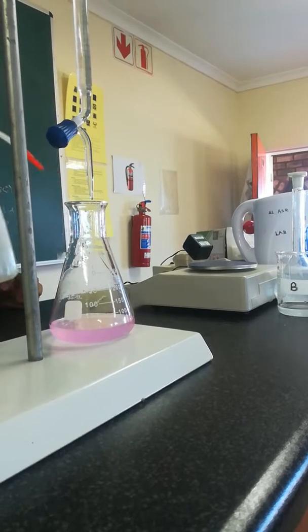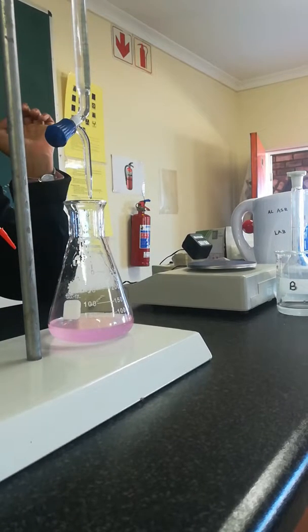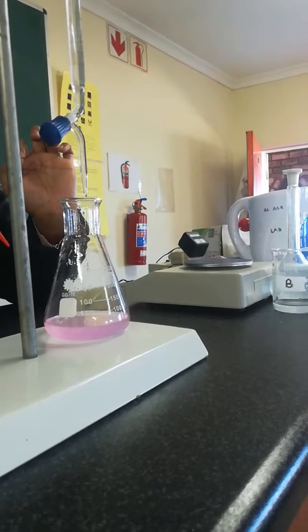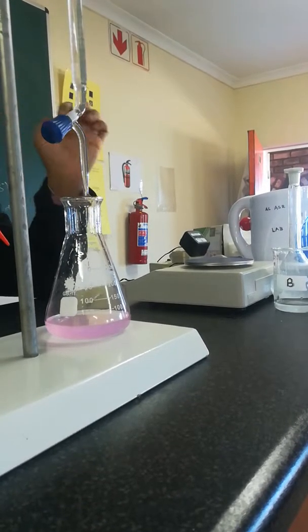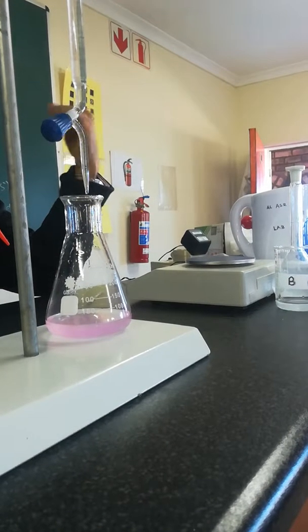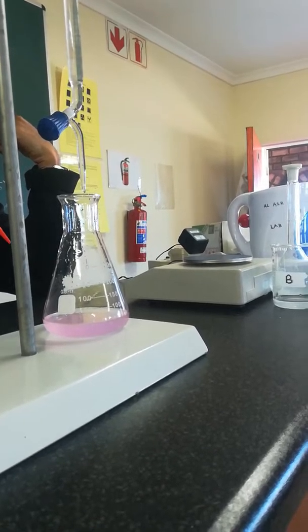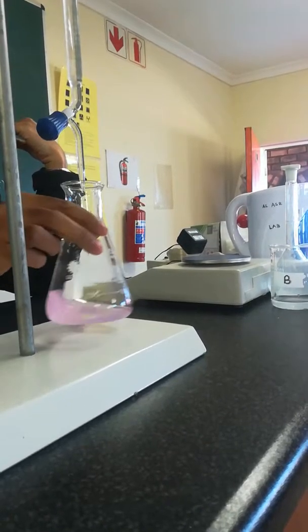And you see there hasn't been a change. The color has turned pink. So this is end point. But it's white almost. No, but it's not white. Come see. It's not white. So this is end point.